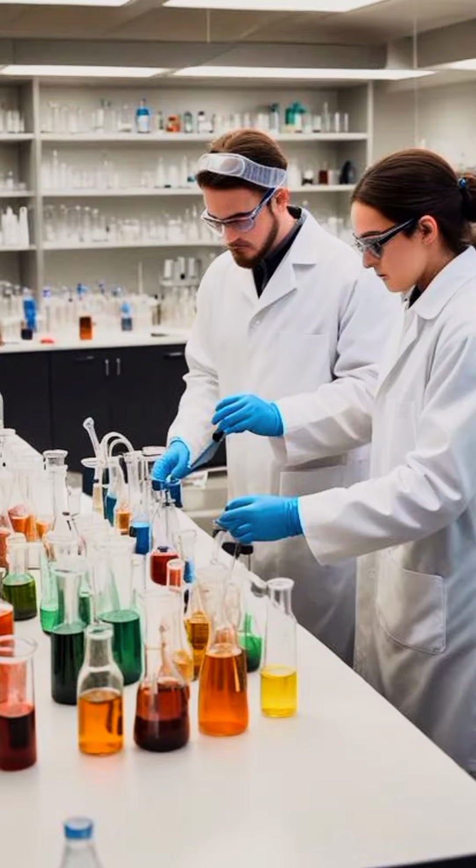So once I compare these two, when I add sodium hydroxide I see a blue precipitate, and when I add barium chloride I see a white precipitate. It is telling me that this salt is copper sulfate, and that is exactly how we come to know every chemical substance, because every chemical substance has its unique chemical identity. By doing that, chemists have found ways to check different things, and we were able to come up with a full note of every chemical substance.